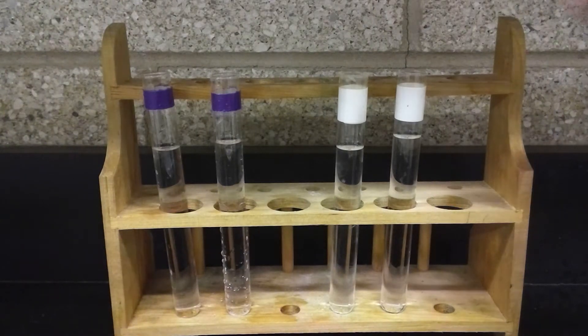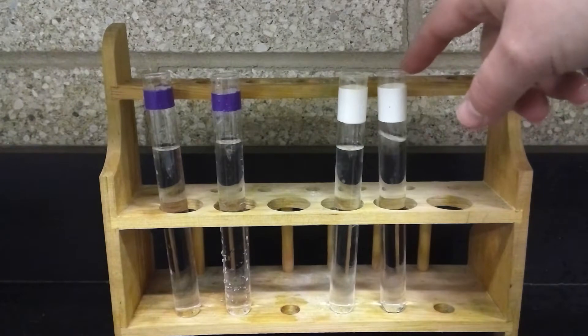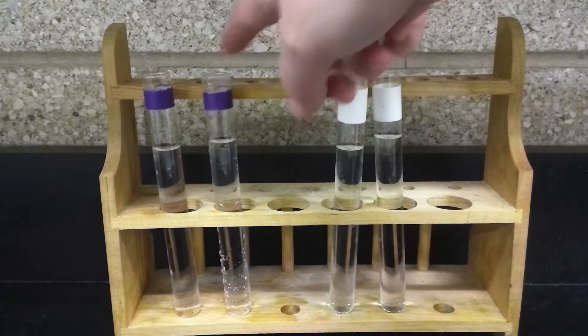All right you guys, on the right is my alcohol in the white and on my left is the water with the purple.